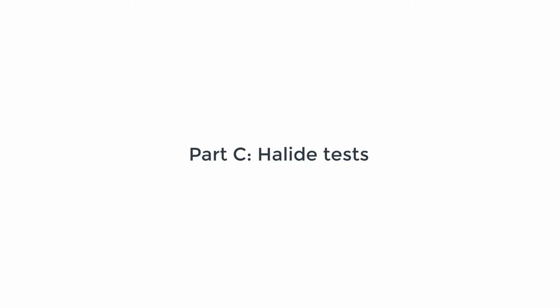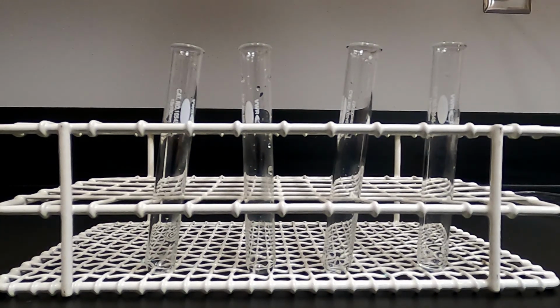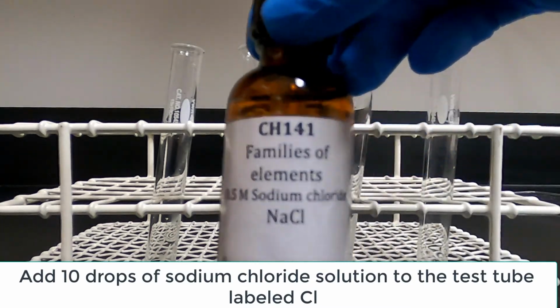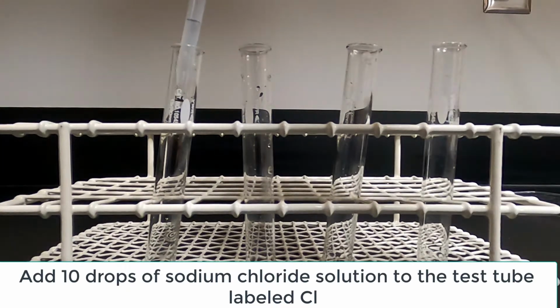Part C, halide tests. Obtain 4 test tubes and a test tube rack. Label the test tubes as chlorine, bromine, and iodine, and unknown. Add 10 drops of sodium chloride solution to the test tube labeled chlorine.